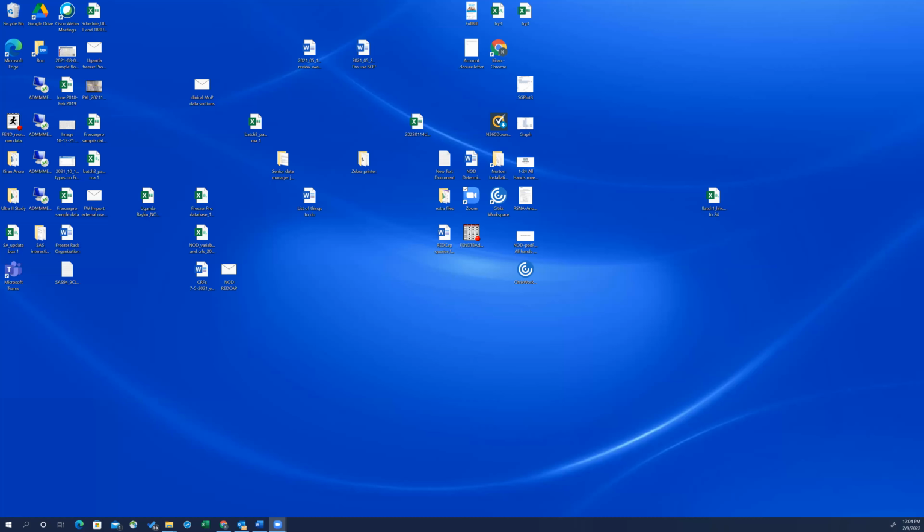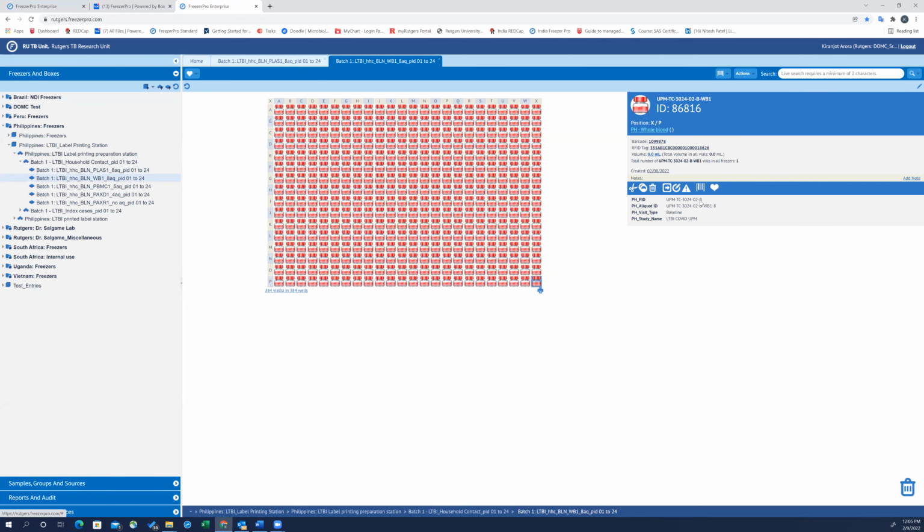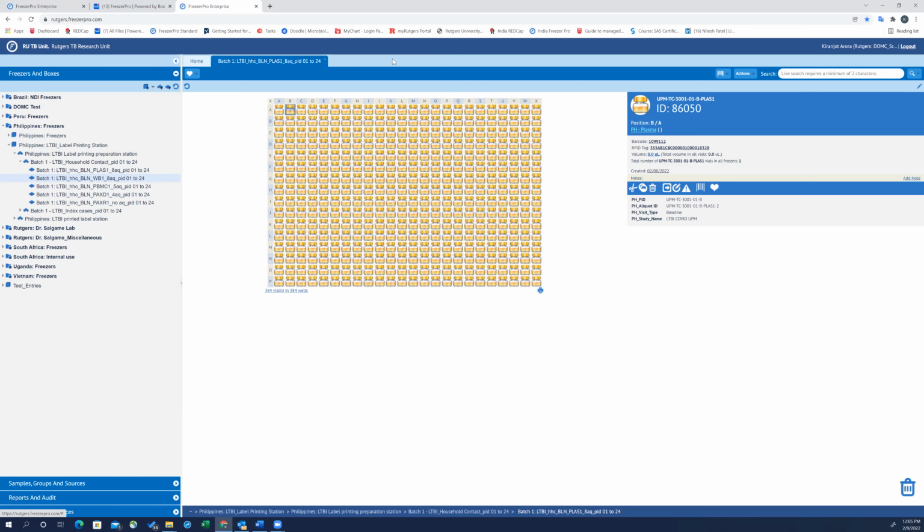Let me share the other screen. Let's see better over here. So this is the sample name over here. It contains information regarding PID and abbreviation of the sample type. And for both aliquot IDs and sample name, we want to add the information regarding the visit type. So a 3-character abbreviation of the visit type. So here are all the different samples. So these are the plasma samples. Similarly for whole blood samples, we don't have anything about the visit type. We'll be adding that here.